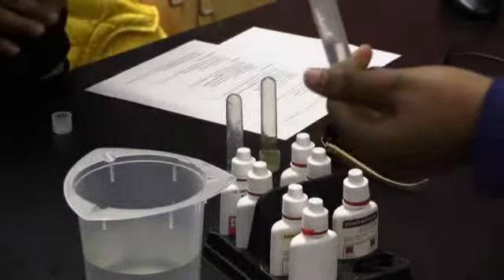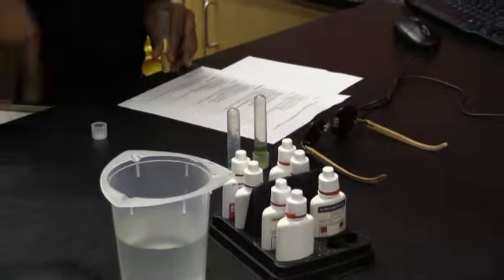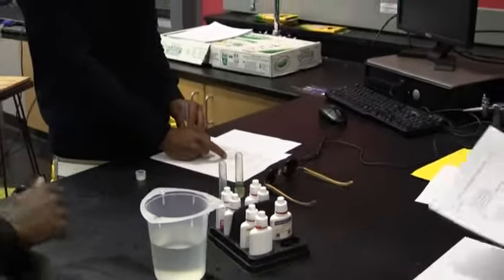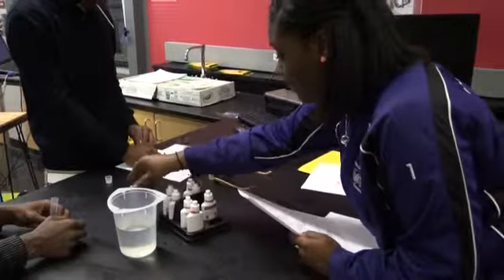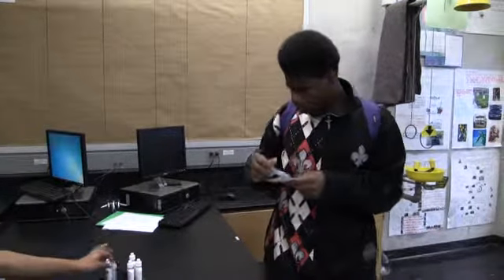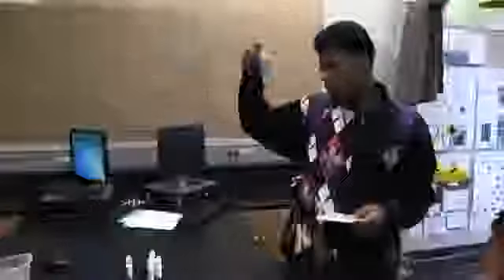I don't know what to do, that's why I'm waiting on some instructions. Which one are you doing, PJ? We did the pH, we did the nitrate. So this is pH — pH we go last, and this one we go first. So we've got nitrite. The first one we did right here — it's a little bit dark, you know what I mean?